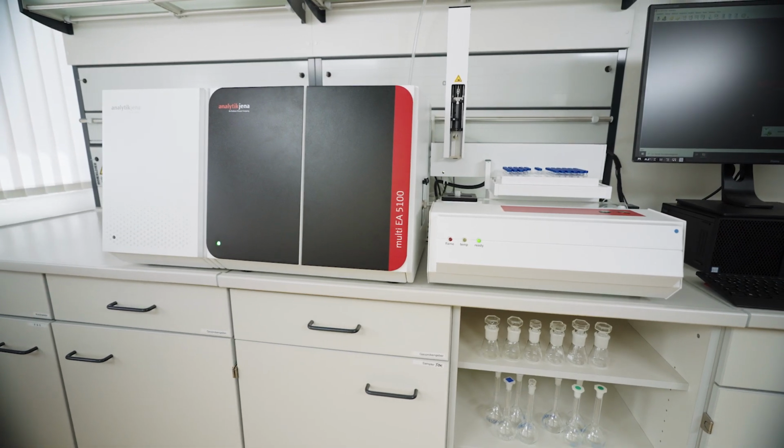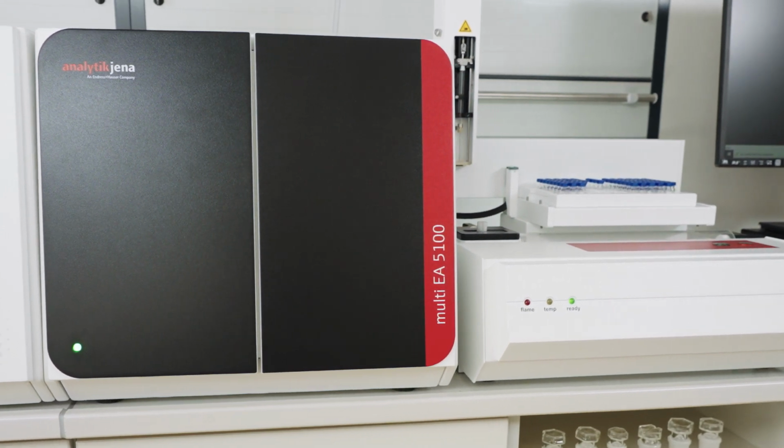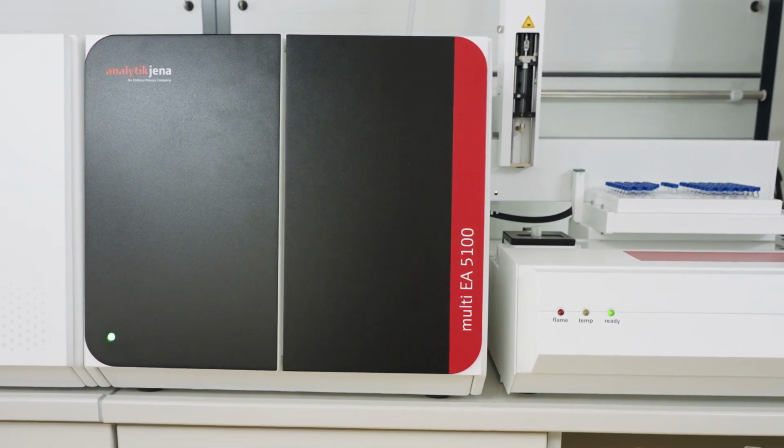For analysis of the prepared samples and standards, we will use a multi-elemental analyzer. It allows the analysis of chlorine and sulfur, both important quality markers in the analysis of edible oil and other refinery products. The analysis of fatty acids or comparable matrices with complex structure requires a well-thought-out sample supply strategy. Otherwise, these samples cannot be combusted completely and form residues.